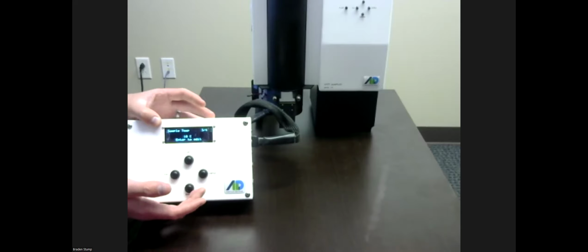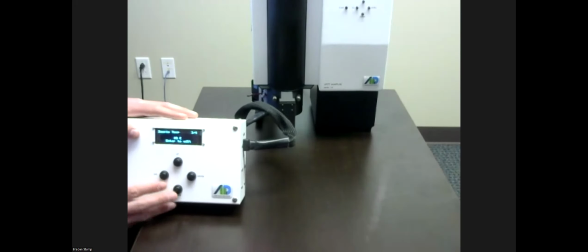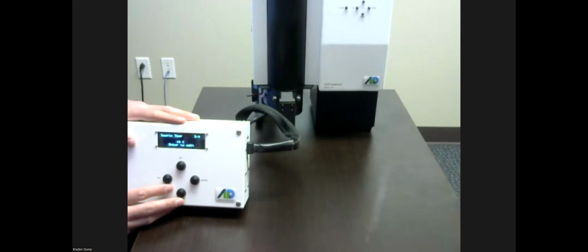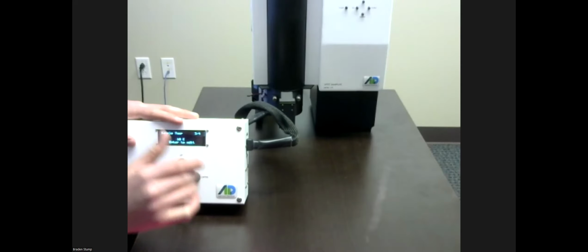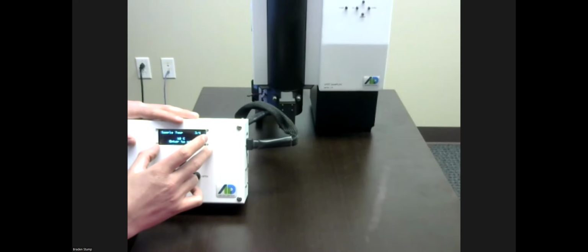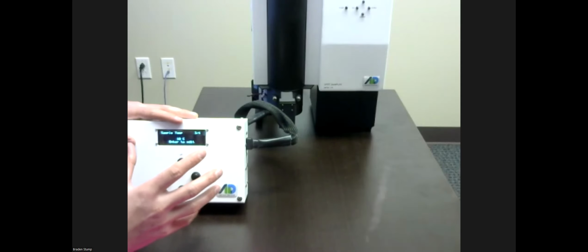Sample temp, I have listed as 10C. That is the temperature around the vial here. General recommendations would be for the BioSpot Gem to start at a 12C sample temp, and for the spot sampler to start at a 10C sample temp. If your ambient environment or your aerosol conditions are causing you to not be able to control liquid vial level, this is a good place to start, based off of how much aerosol concentration you have in the air.